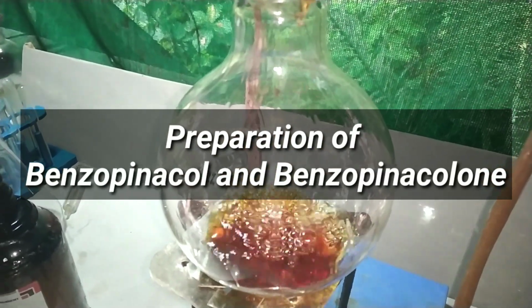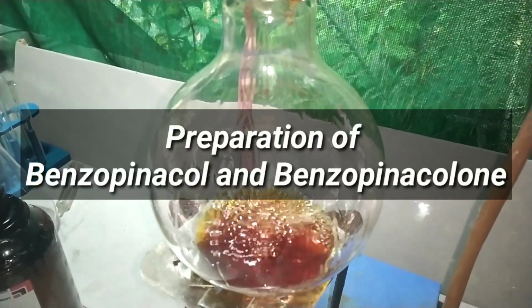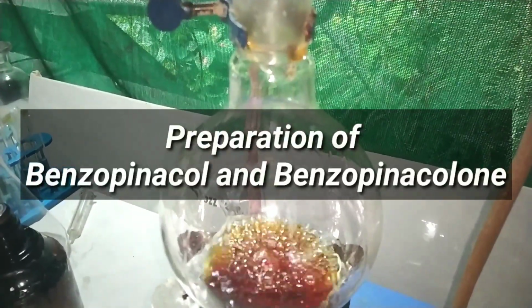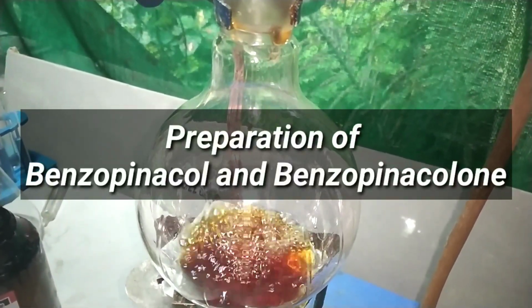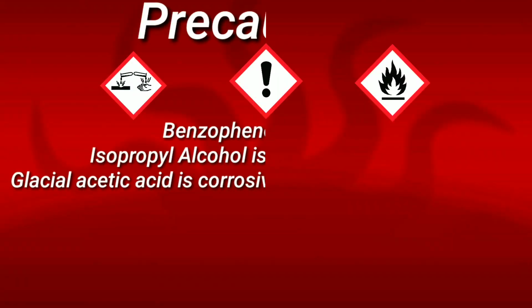Hello friends, in this video we will first prepare benzopinacol by photochemical reduction of benzophenone and then make benzopinacolone by the pinacol-pinacolone rearrangement reaction.